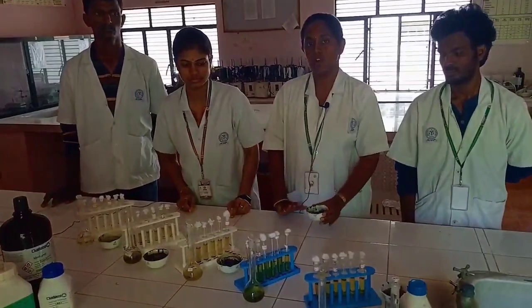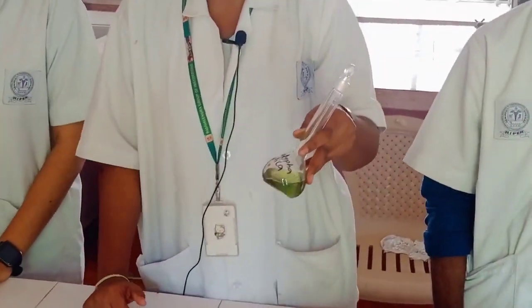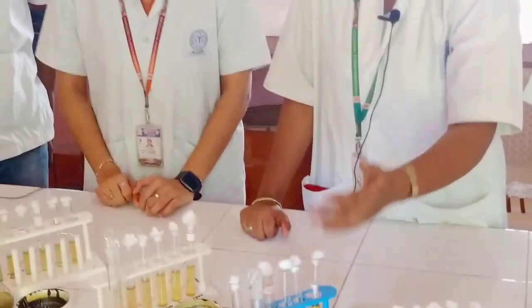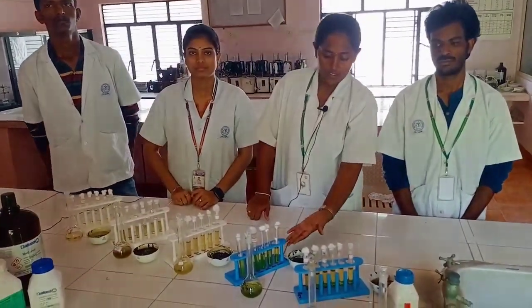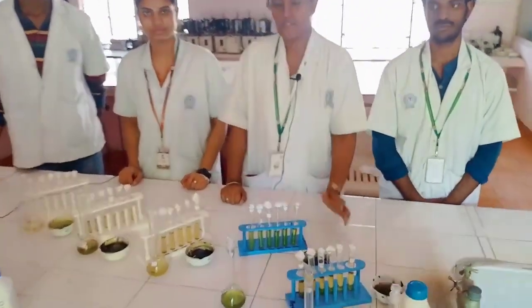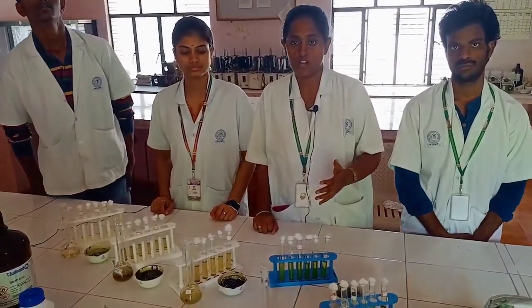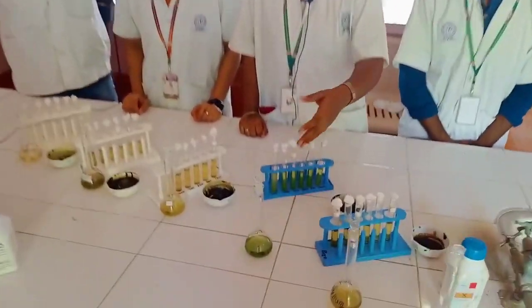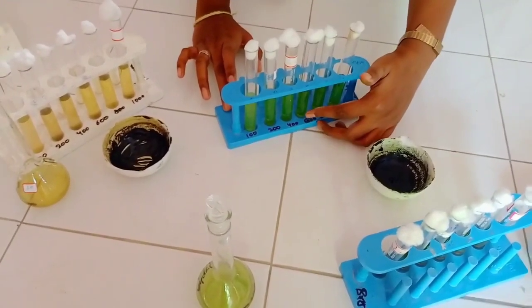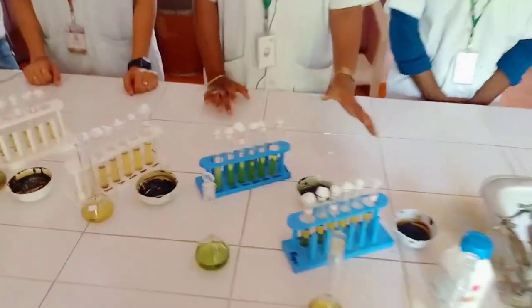This is our product. From this product, we prepared the stock solution. Stock solution means a fixed concentration in a fixed volume. We prepared a stock solution of 1 mg in 1 ml. From that stock solution, we prepared dilutions of different concentrations: 100 µg/mL, 200 µg/mL, 800 µg/mL, and 1000 µg/mL. These dilutions were done for every plant material.